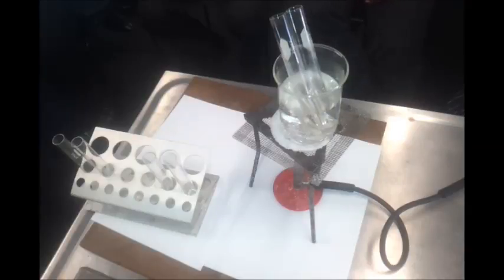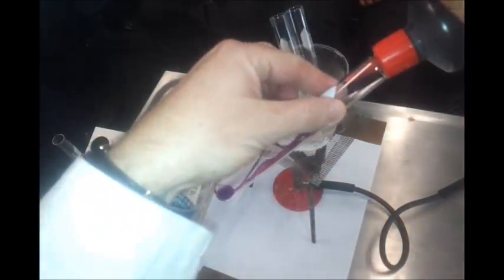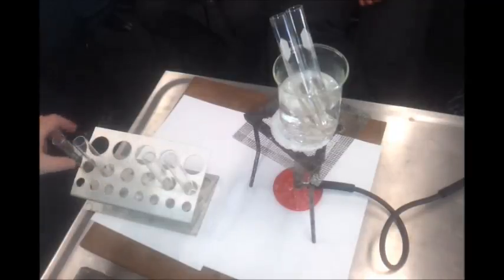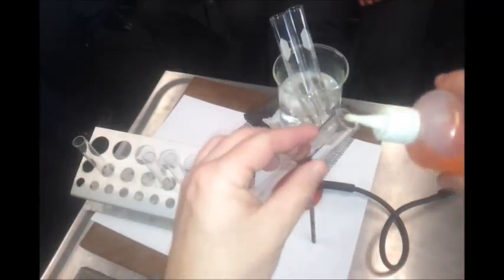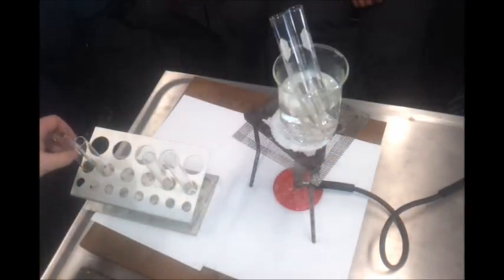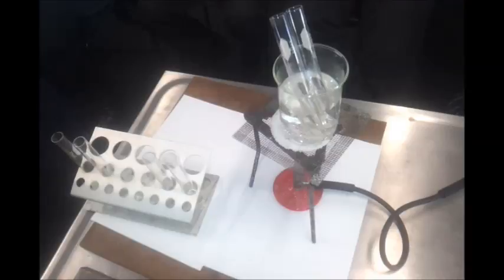What I've got, first of all, is some potassium permanganate, which is a purple solution, which I'll show you in a clean test tube. So there we go, pinky purple colour. That's the potassium permanganate, and I've got potassium dichromate. Now the potassium ions are just spectators. They're not doing anything. Potassium dichromate is an orange colour. So what I'm going to do is acidify those in just a moment and add them to my ethanol and see if anything actually happens.